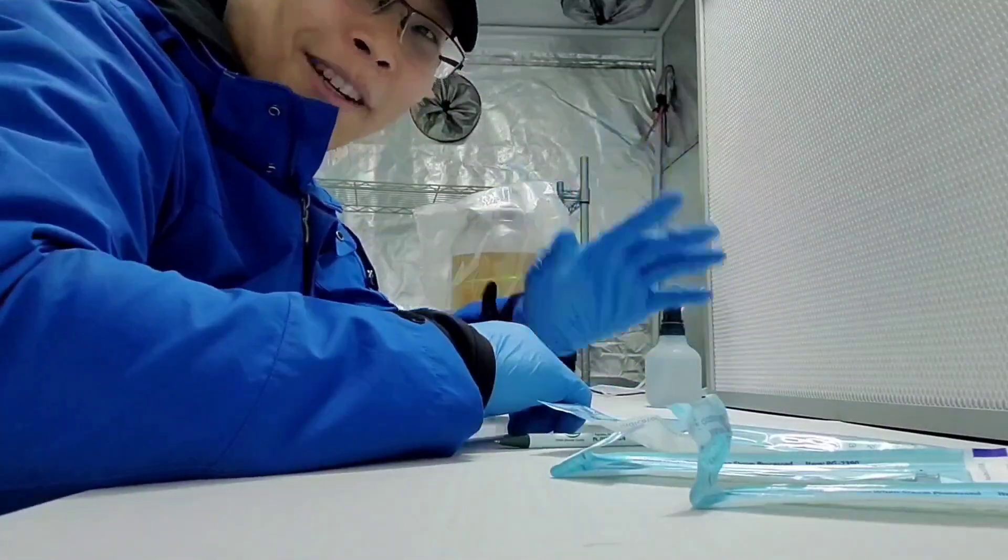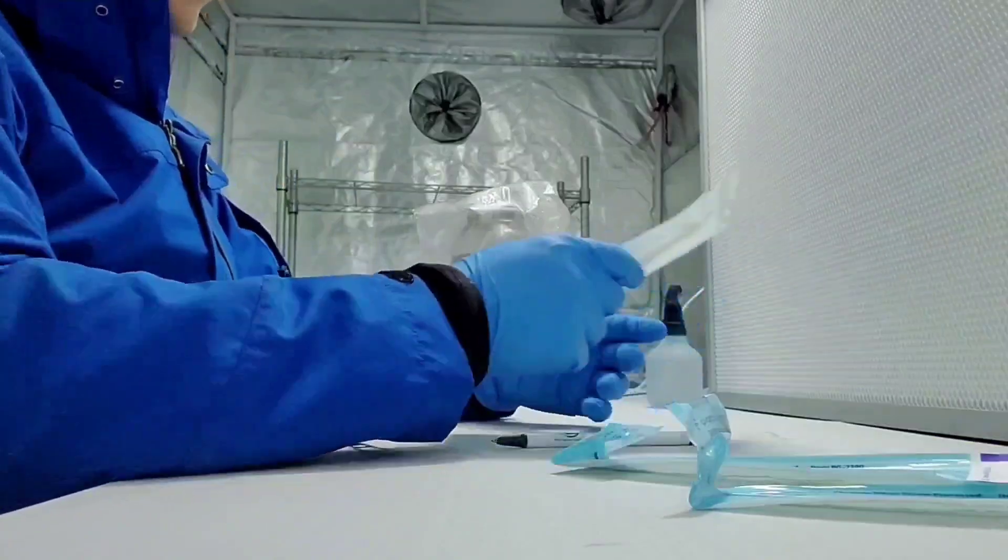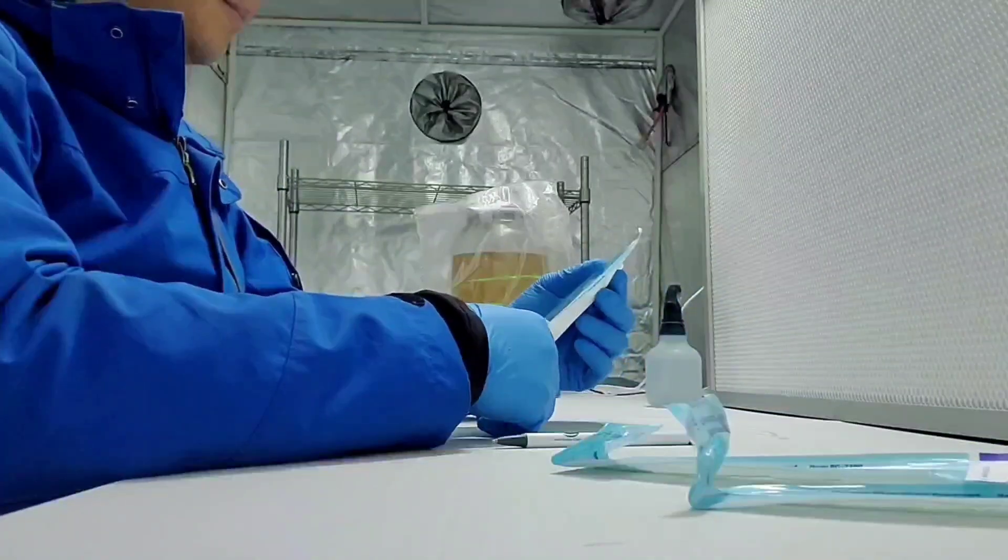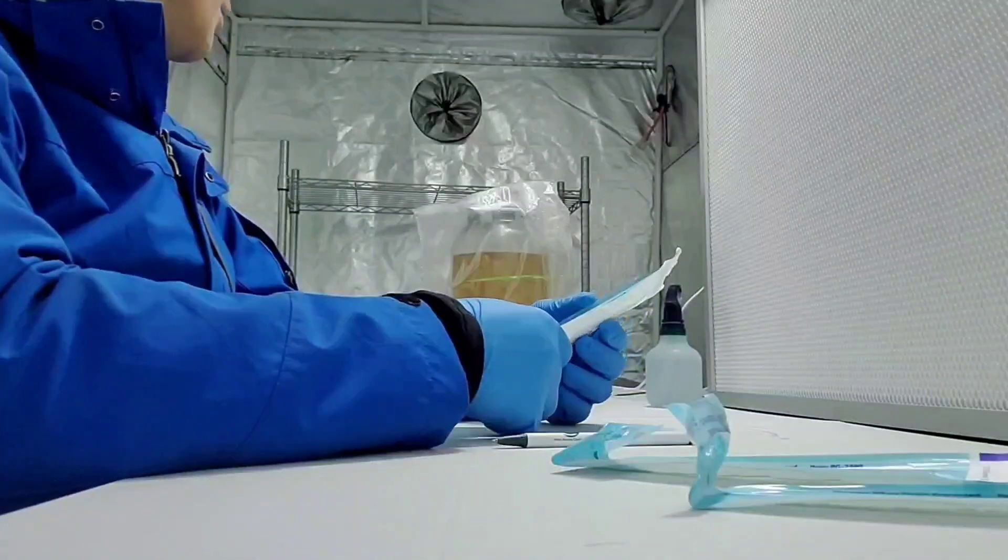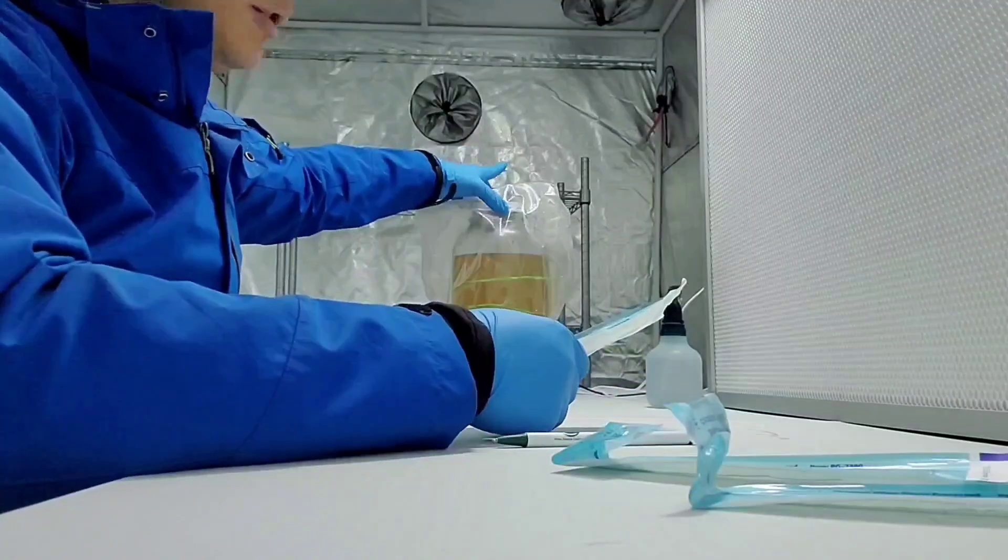Hey guys, this is Kampo. Today I'm going to inoculate a production batch.